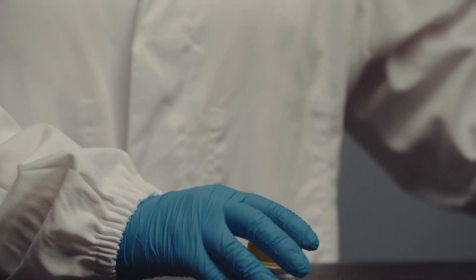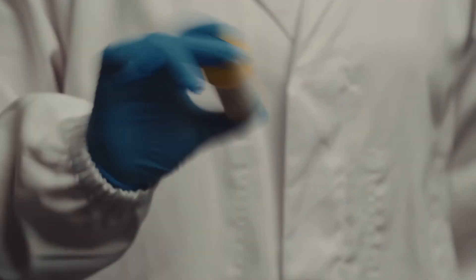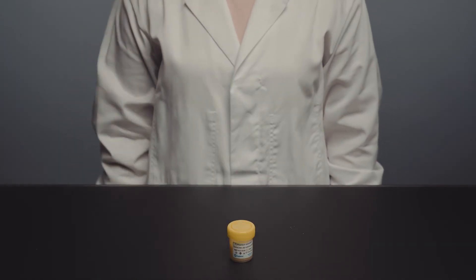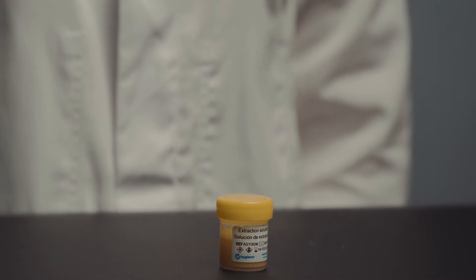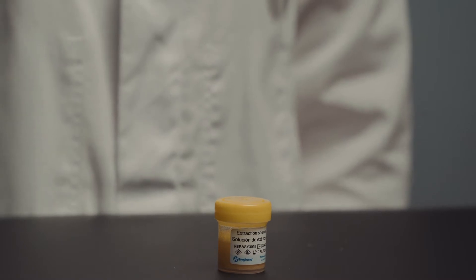Step four, shake the mixture vigorously by hand for two minutes. Step five, place the container on a flat surface and allow the solids to settle to the bottom. Normally settling takes about five minutes but it can take longer. Wait until a thick band of clear liquid forms.